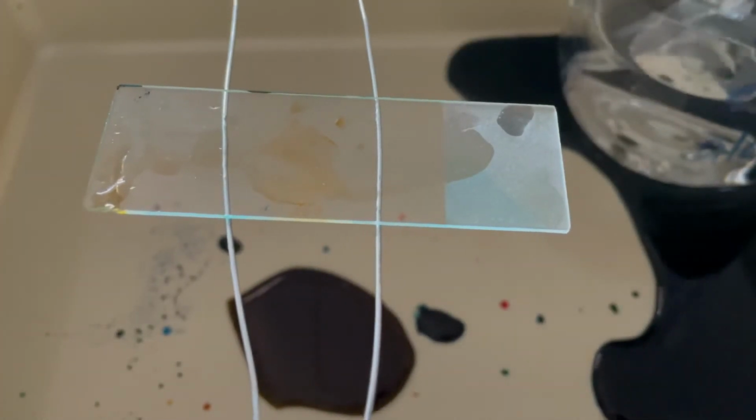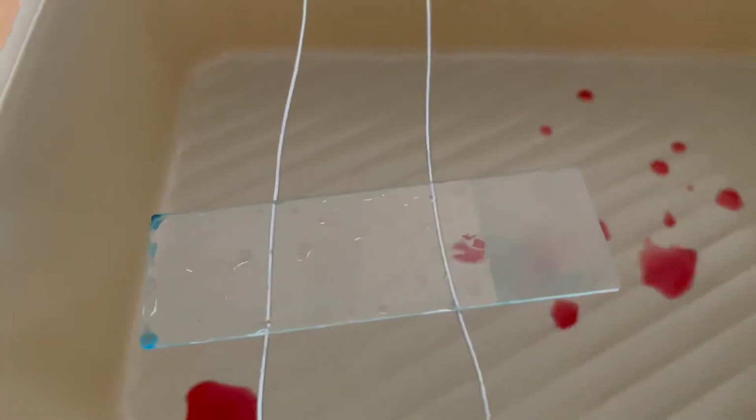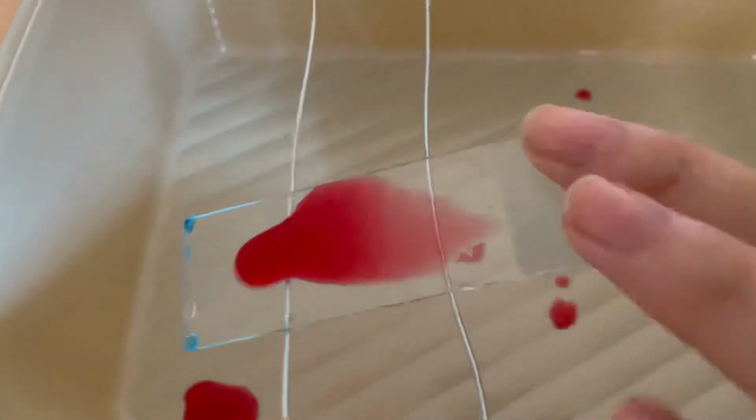Then, the smear was decolorized with 95% ethyl alcohol by adding the reagent drop by drop until the alcohol runs almost clear, showing only the blue tinge. This step is known as solvent treatment. And again, rinse with tap water. The smear is counter-stained with safranin solution for 45 seconds. And again, rinse with tap water.